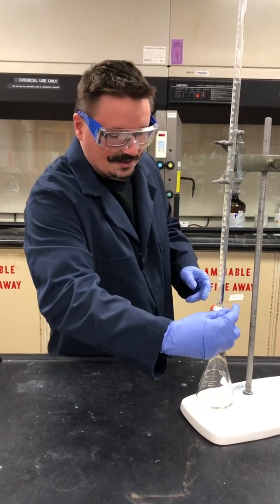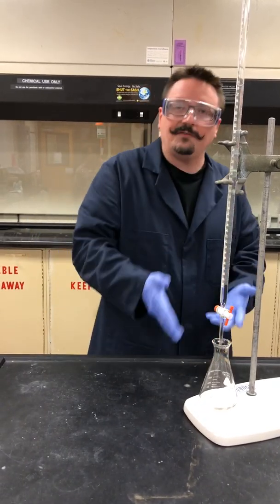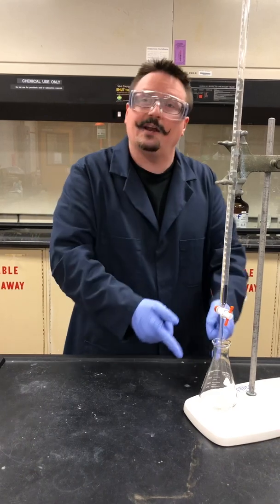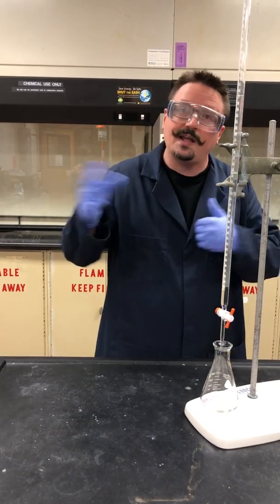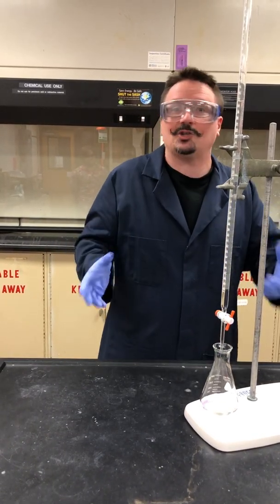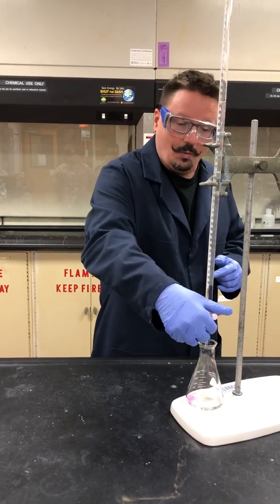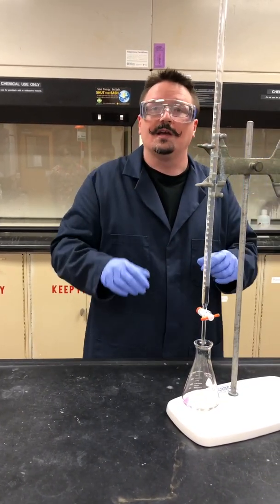I'm just going to start adding some of this, and we have to know what the reaction is. We know I have sodium hydroxide and I know I have hydrochloric acid. So we can write that out and see what the actual specific reaction is. We can see that it has one-to-one stoichiometry.